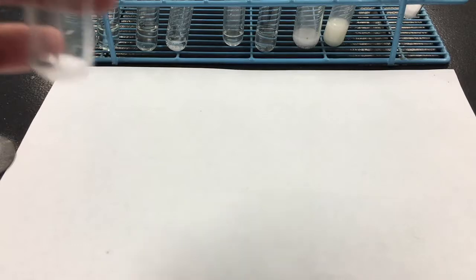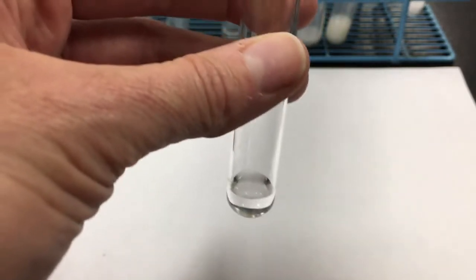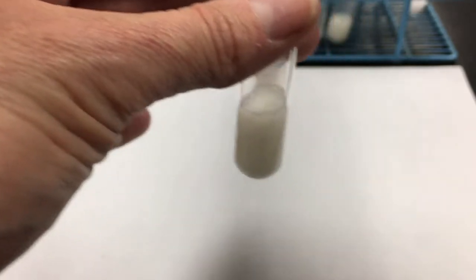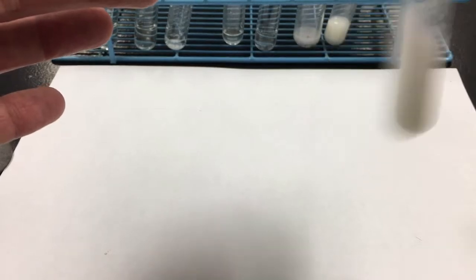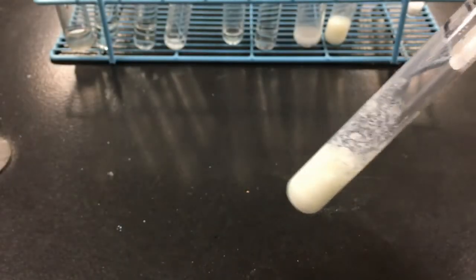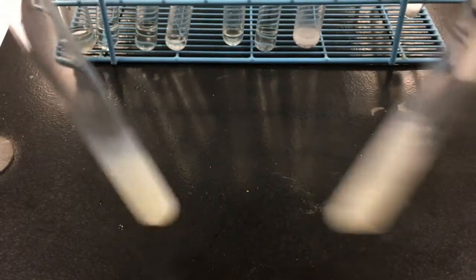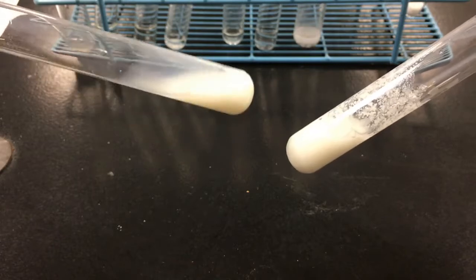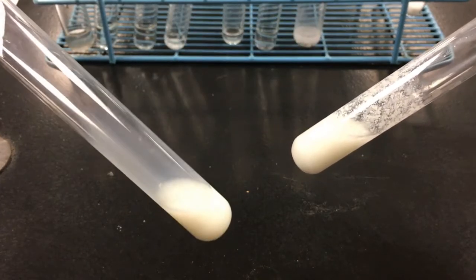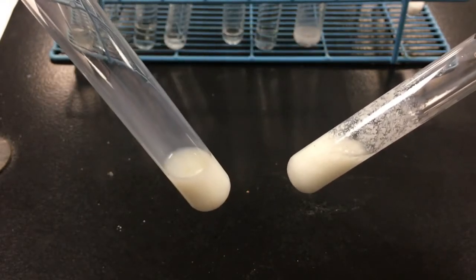Test tube 9. This is going to be 2 liquids this time. I'm going to have liquid 2 and then liquid 3. Give that a little bit of a shake. Oh, okay. I'm going to move the white paper so you can maybe see that a little bit better. When I shook this test tube that had the white liquid 3 in it compared to my other test tube that had white liquid 3 in it, experiment 8 leaves a little bit of residue on the side of the walls, but it eventually runs back down to the bottom of the test tube. The liquid doesn't stay clung to the sides of the test tube.